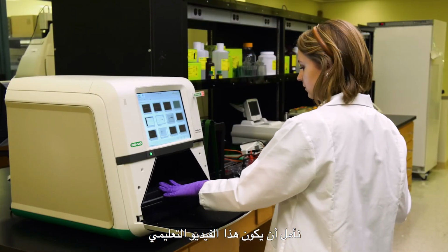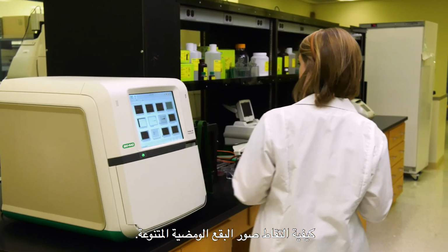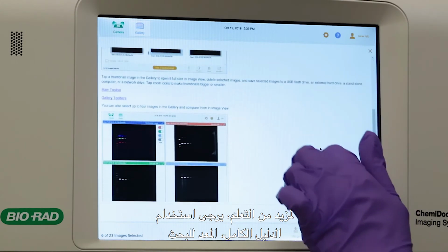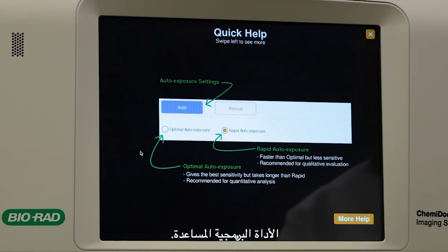We hope that this instructional video has helped you to learn how to capture multiplex fluorescent blot images. For further learning, please use the complete searchable onboard manual or the Teach as you Tap software assistance tool.